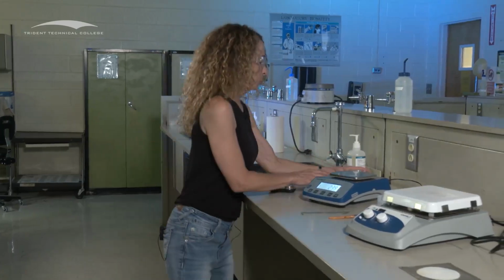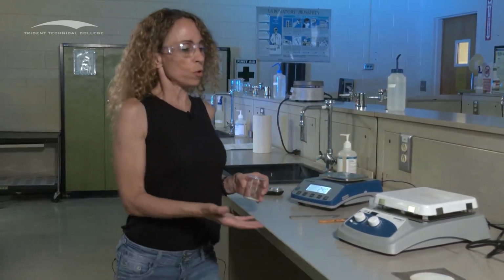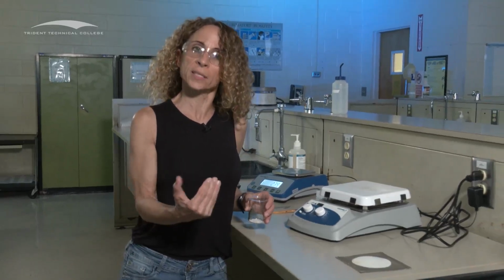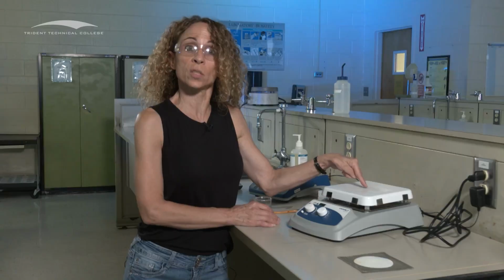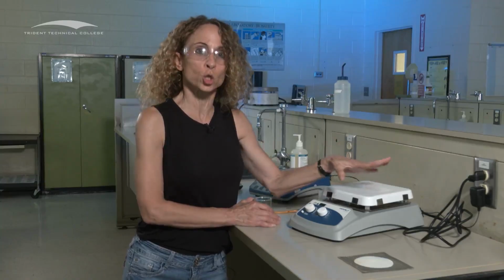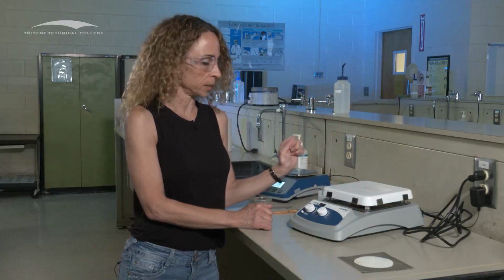Okay, so when you go to heat to a constant mass, you're going to have your solid in the beaker. And we're using a hot plate. The key word here is hot. This surface is going to get very hot. We're setting it to get about 200 to 250 degrees Celsius. You do not want to have anything near the surface, including any pens or anything. They will melt. You don't want to touch this with your hand, okay?